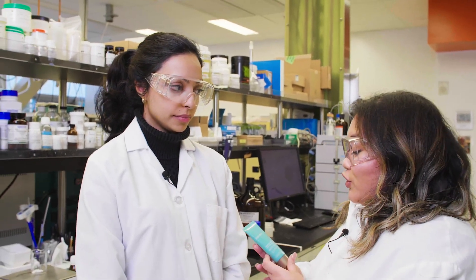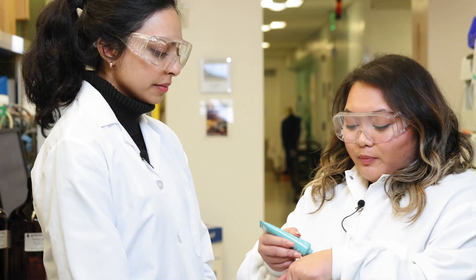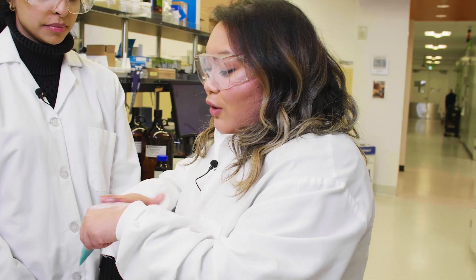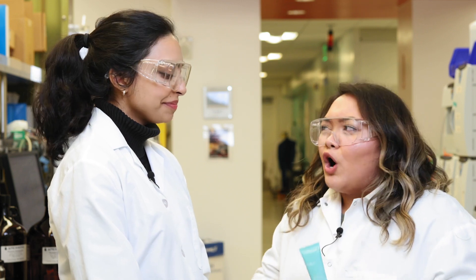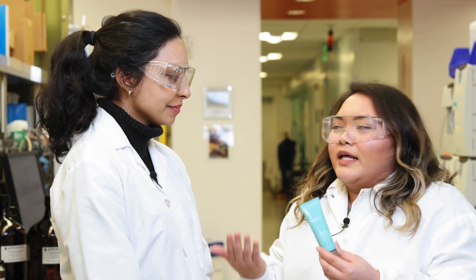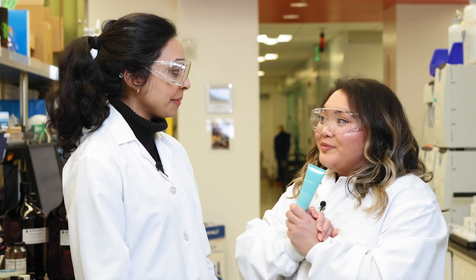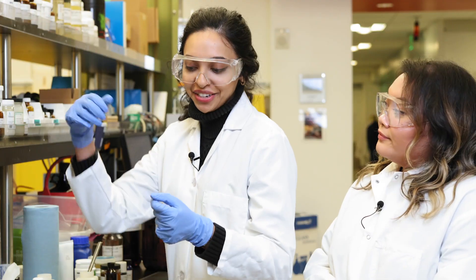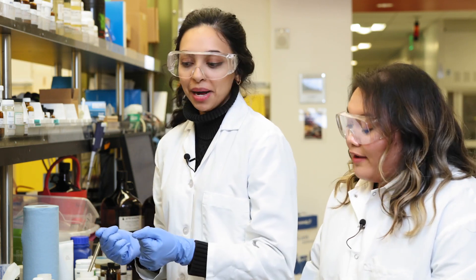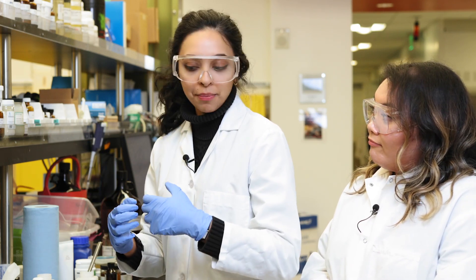The genius behind it all — it's a team effort. So we're actually in the lab so that you can show us how you created our Sheer Mineral Sunscreen. I've tried it already, and it's super blendable, super moisturizing, and it just absorbs so quickly. I'm here for a behind-the-scenes look on how you created this, what ingredients make it so unique and blendable, different from all the other sunscreens out there. You're in luck because I happen to be making a batch right now. I'm going to get started by weighing out our key materials. You can't just stir zinc oxide into a cream — it doesn't work. There are certain ratios and ingredients we need to make sure everything stays together and works as a cream.